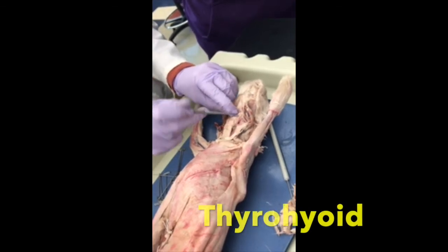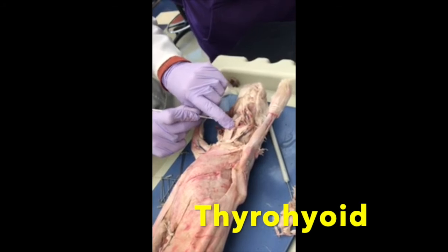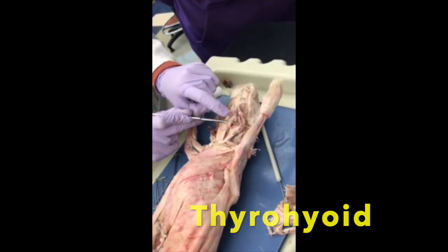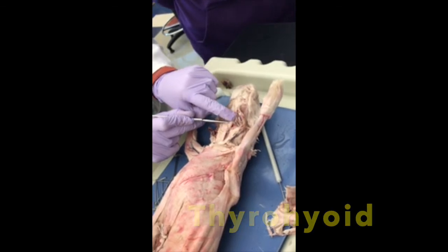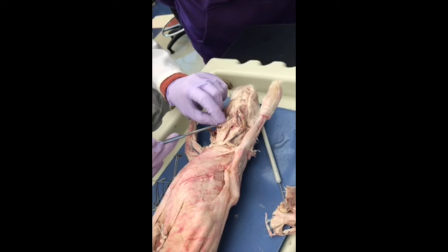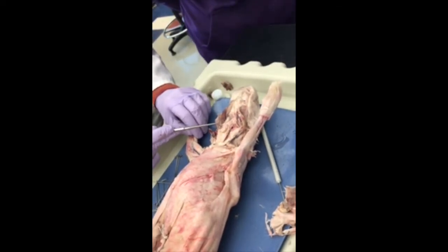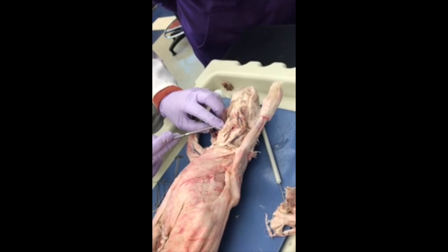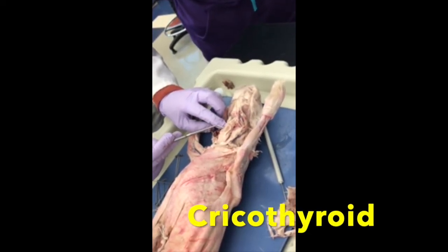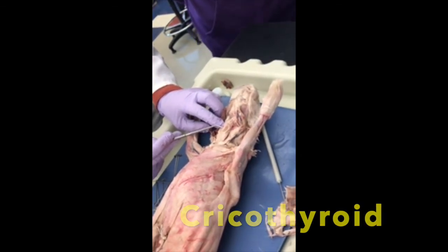The next one is the Thyrohyoid. You see where the Sternohyoid stopped? But now a new muscle starts. Origin insertion. So that's the Thyrohyoid. When I pull the Sternohyoid apart, there's the larynx. There's my thyroid piece of cartilage. Okay, the brown little muscle, peach little muscle guy right there, is the Cricothyroid. You can't pull it up. It's just a little spot.